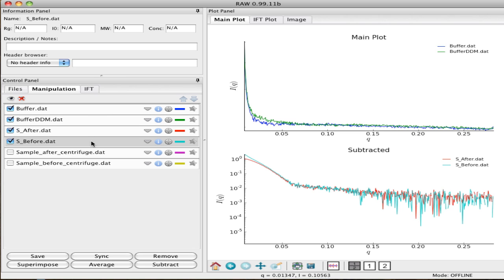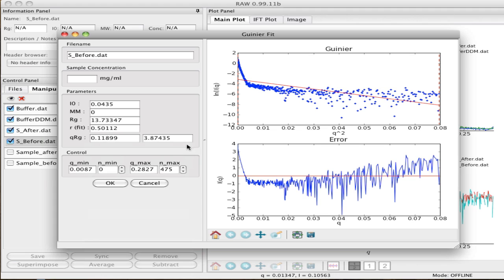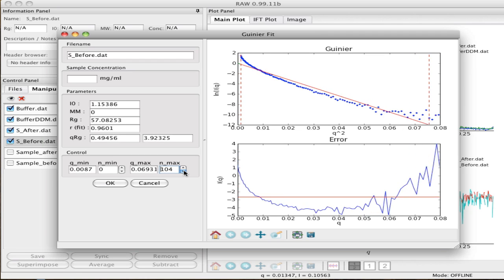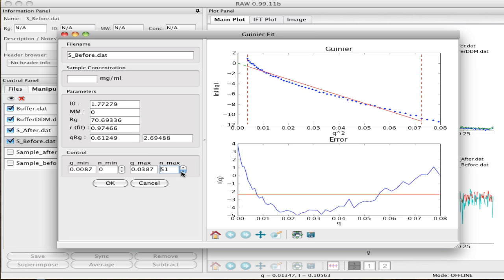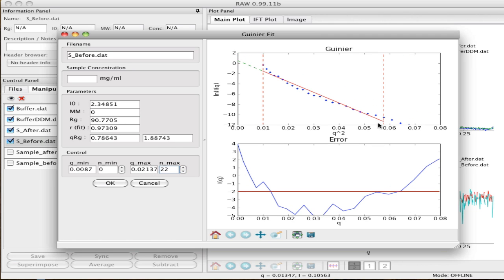If we do the Guinier analysis on the before curve, you invoke the Guinier tool, and you can see there's a region here that looks like it might be linear, and you zoom into that. I'm going to bring the Guinier region down. Now this is quite common. You'll see a case where the curve looks like it wants to be linear, and then it twists upward. If we go all the way in and try to find a nice flat Guinier region, you'll notice we just can't do it. It's always got a smile to it.